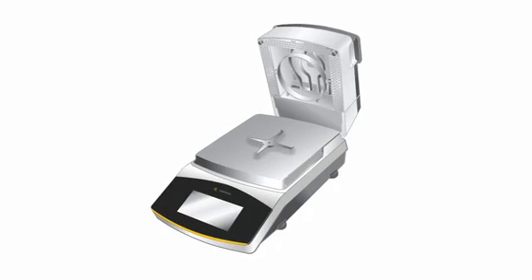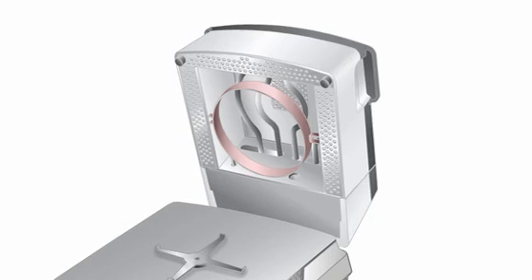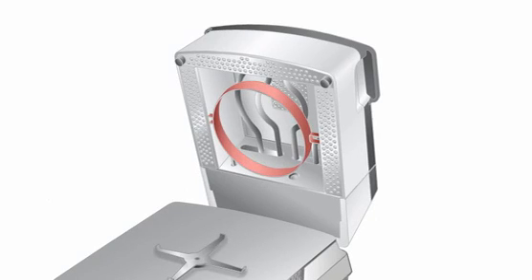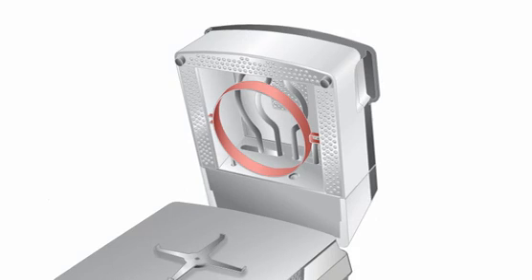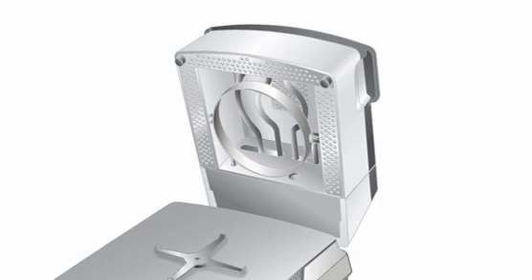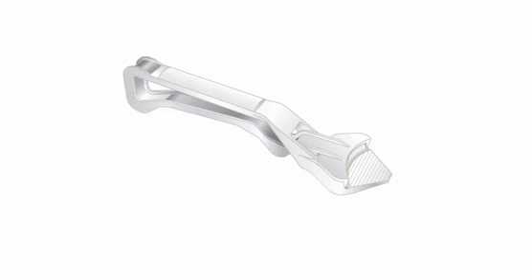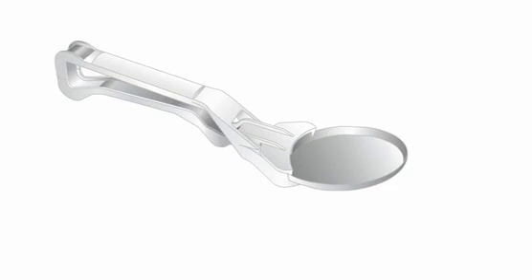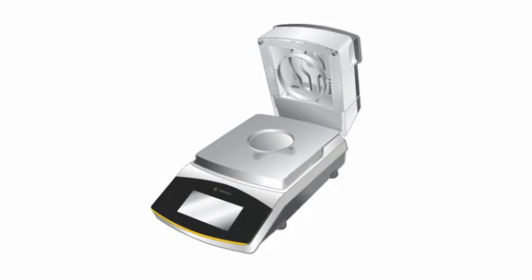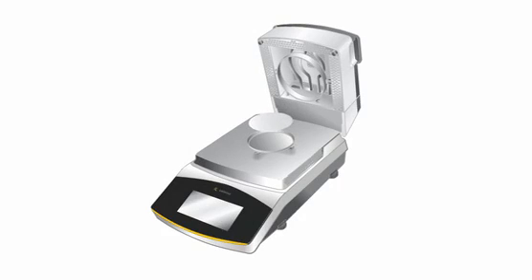Please use the handles on the upper side of the hood. Taring of the moisture analyzer MA-160. The draft shield of the MA-160 is integrated into the hood. It is now possible to place a sample pan or to clean the sample chamber plate without any obstacles. First of all, please place a filter on the sample holder and then lay the sample pan on the filter. Now, place a second filter into the pan.